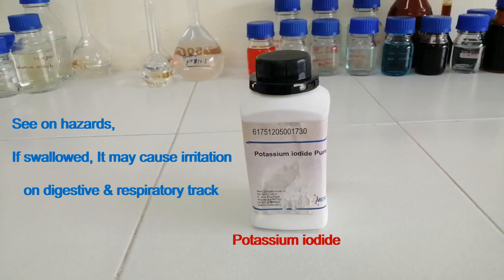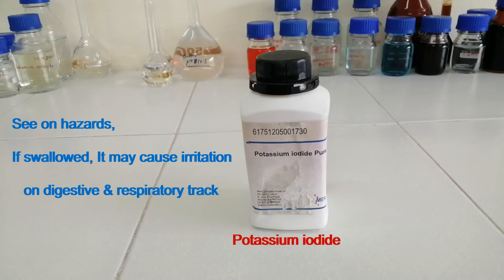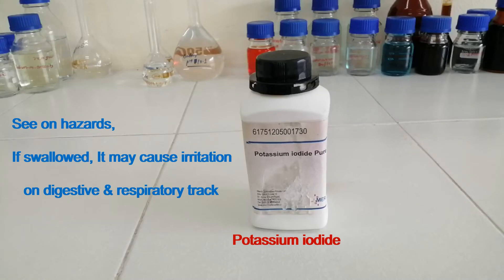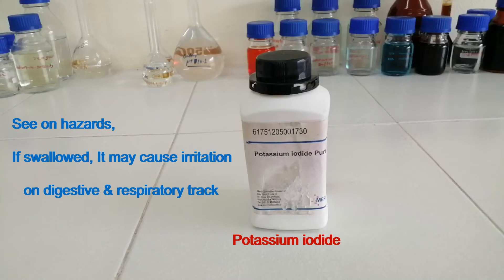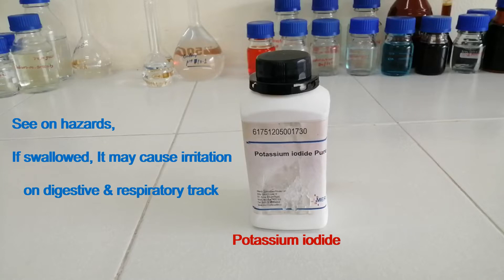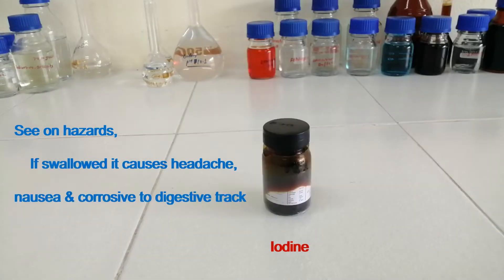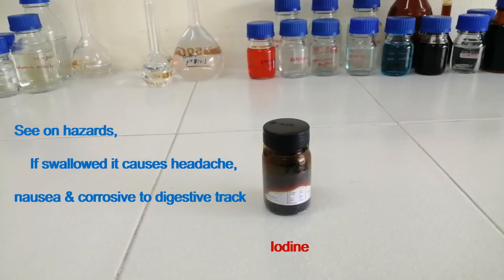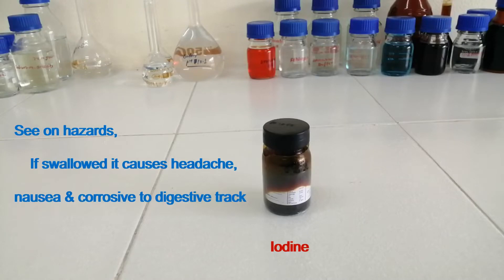This is potassium iodide. See the hazard: if swallowed, it may cause irritation of the digestive and respiratory tract. This is iodine. See the hazard: if swallowed, it causes headache, nausea, and is corrosive to the digestive tract.